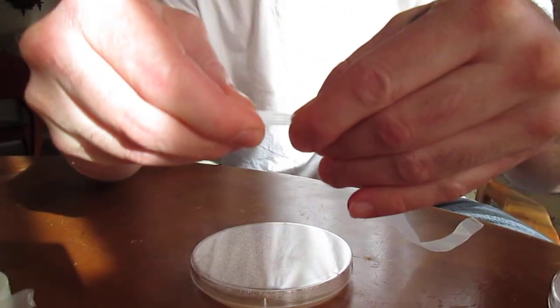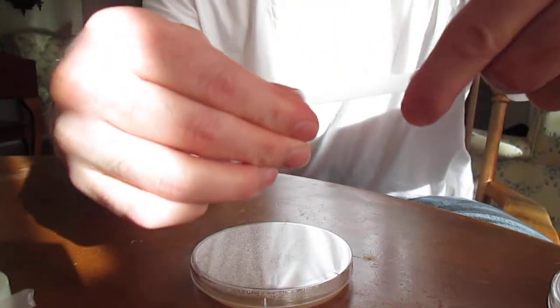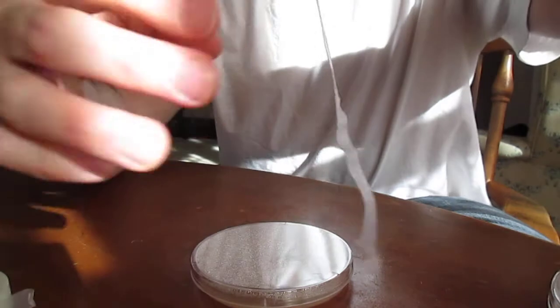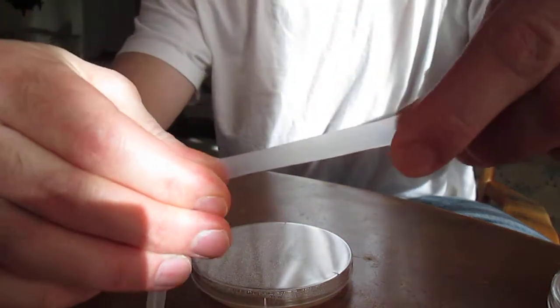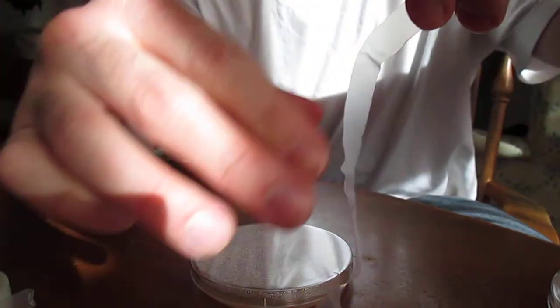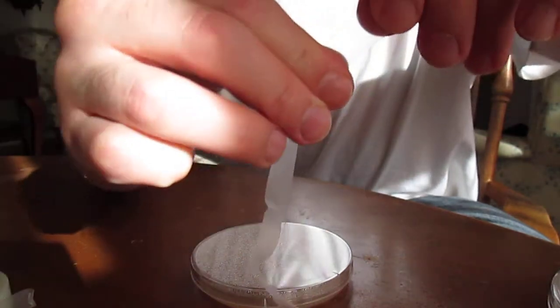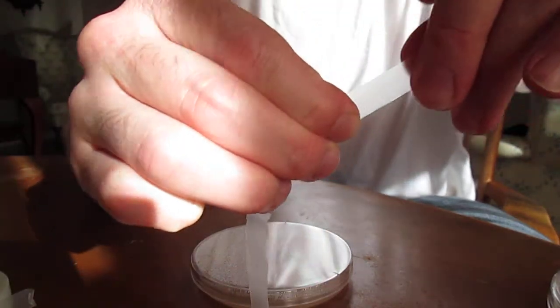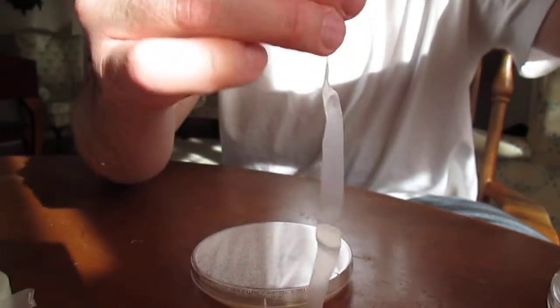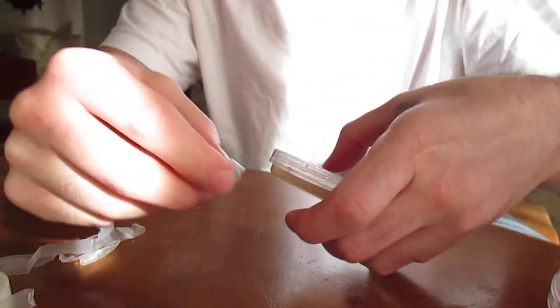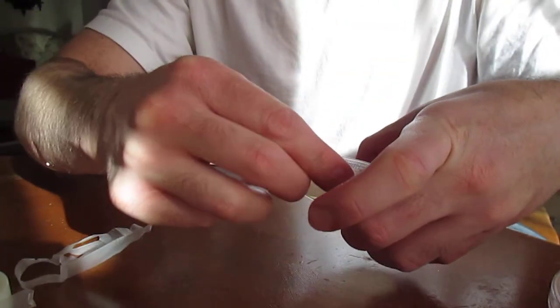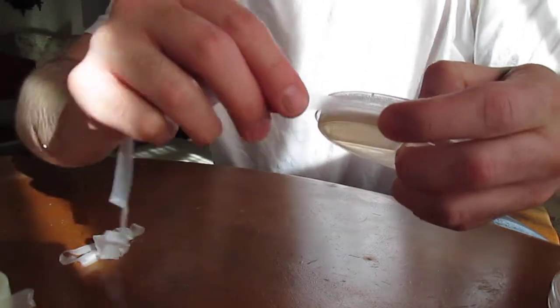You stretch it out a little bit, just like that. Sometimes it takes some practice to do this correctly. Sometimes it'll just break on you. Then what you want to do is pop it on the edge, right around that gap.